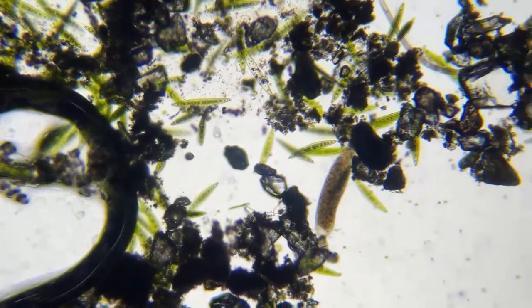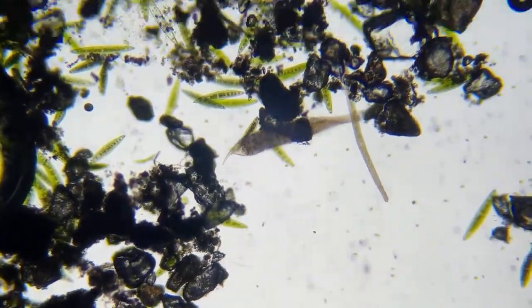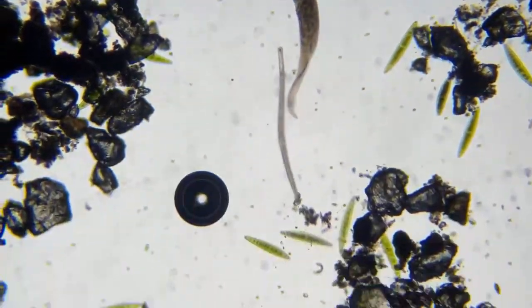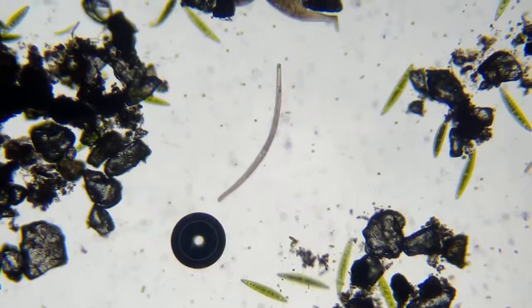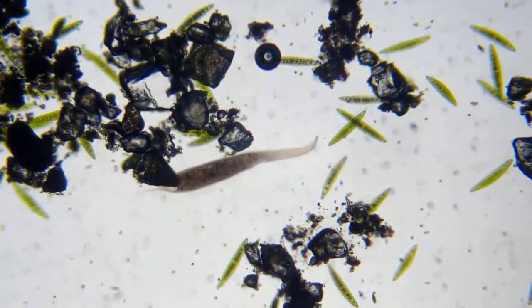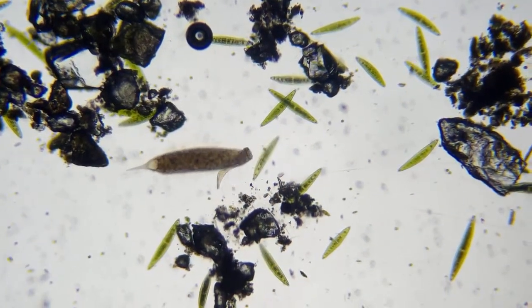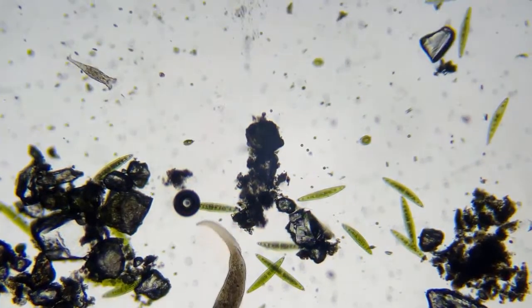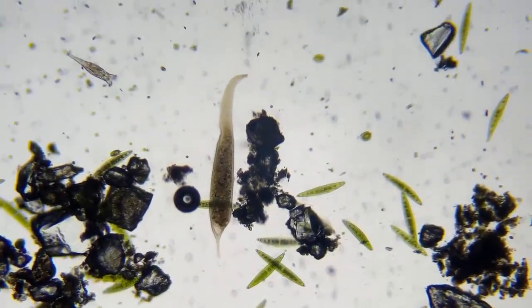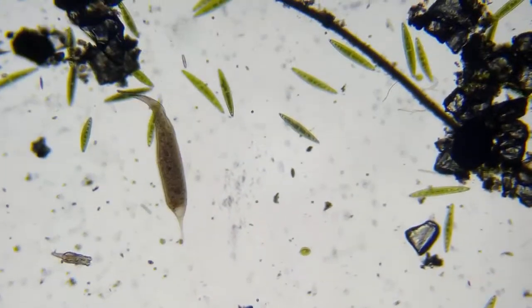So there you go. When I looked at this from Reddit, I was never satisfied. That's a Spirostomum, I think. That's a single-celled organism too. He's not a worm. This is a single cell right here. So it's kind of amazing that these single cells are so big, but the multicellular water bear is tiny compared to these guys.